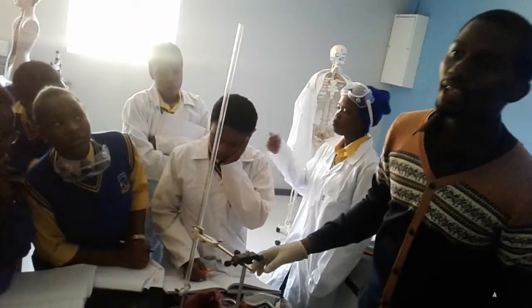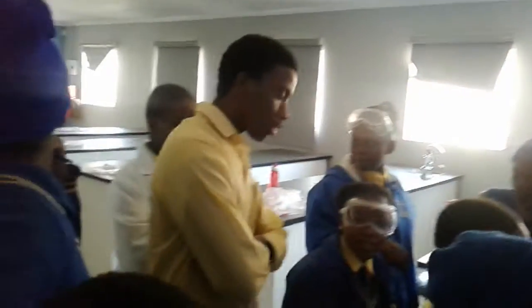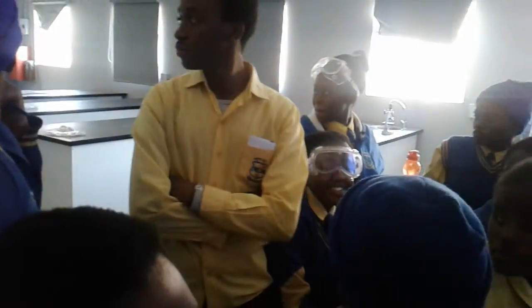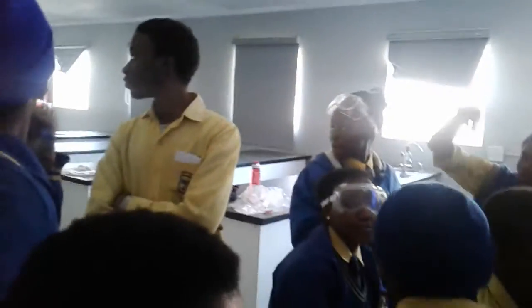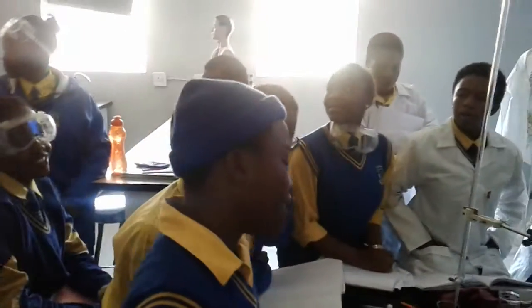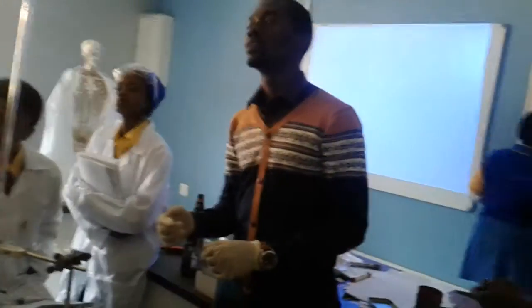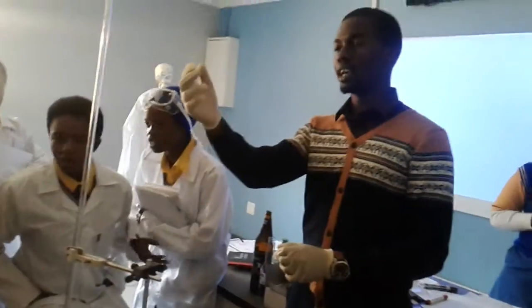And then I'm going to need a funnel. Let's go fetch a funnel. Okay, go. I'll show you what it is. Hurry. That thing is orange. It's paraffin. Go inside. Two is orange. Yeah, take two.